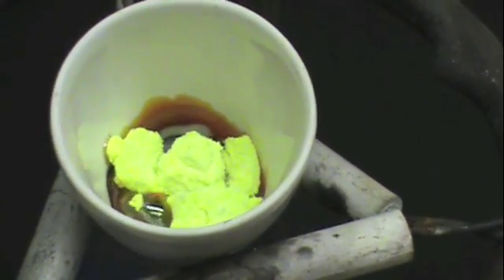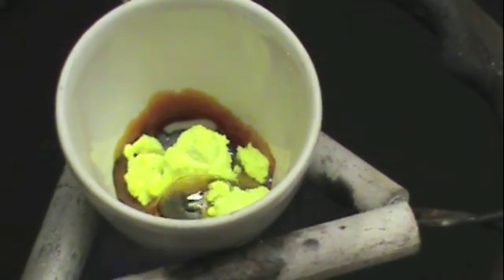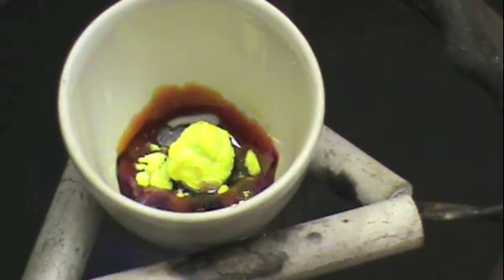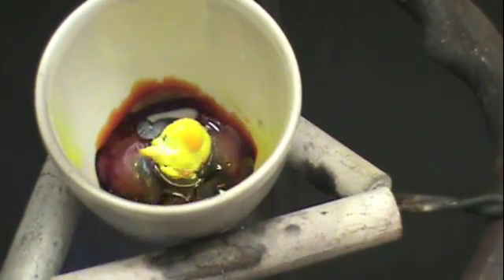You will also notice some vigorous bubbling and perhaps a little bit of smoke coming off of the crucible. This is normal. After a few more seconds, the sulfur is almost completely melted.